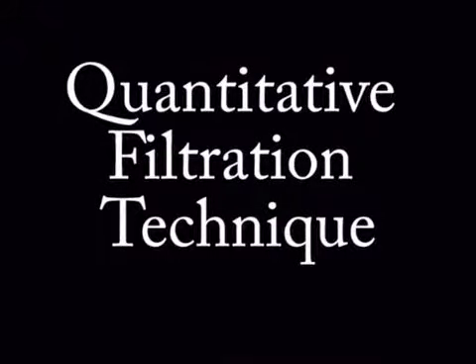In this video we're going to show you proper techniques for quantitative gravity filtration. These techniques will not only help you get good results in your quantitative experiment, they'll also save you a lot of time. The difference in time for good technique versus bad technique can be as much as an hour.